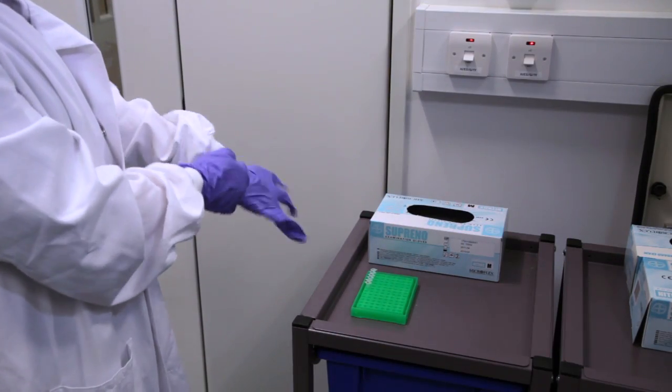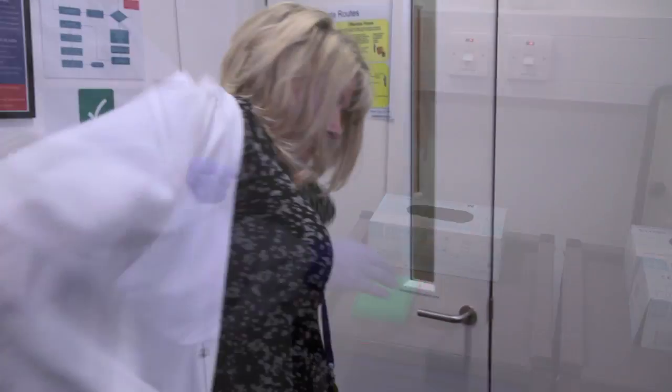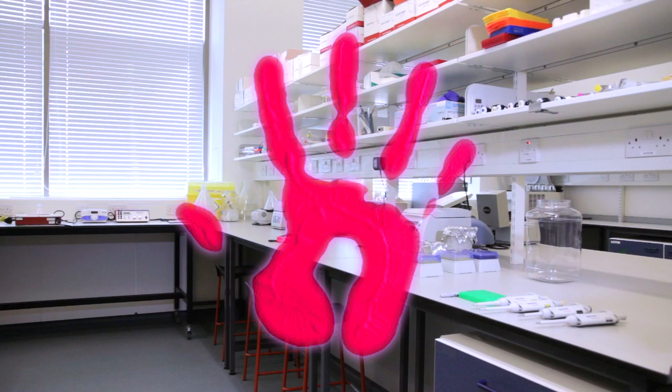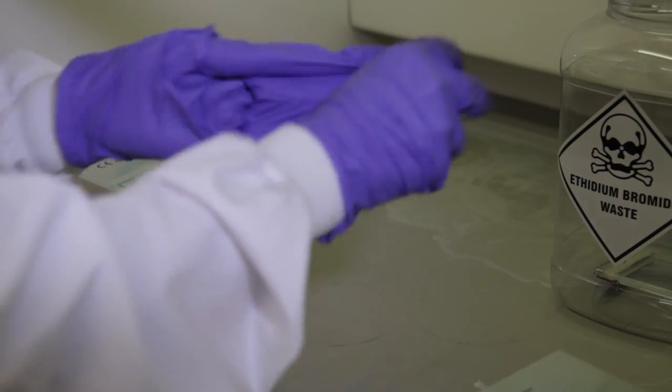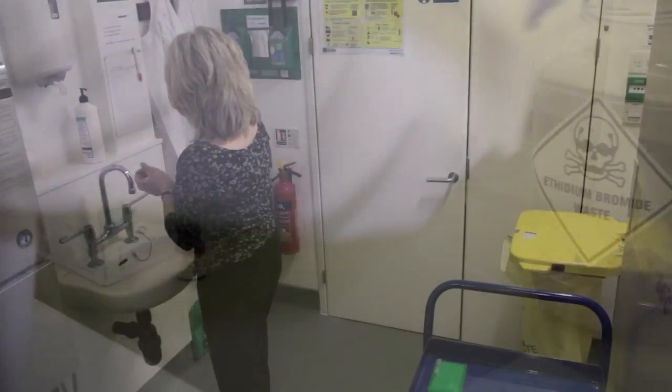Always wear gloves in the gel preparation area and wear a lab coat to protect your clothes. Do not touch the rest of the lab with contaminated gloves. Remove gloves immediately when finished and wash your hands.